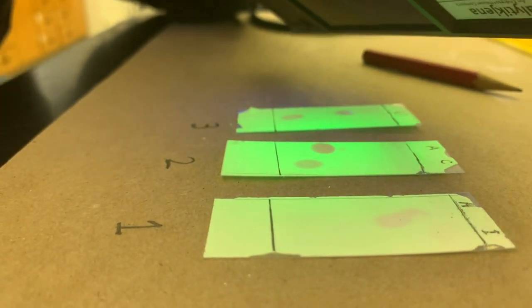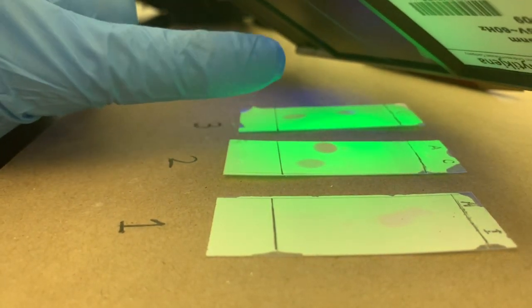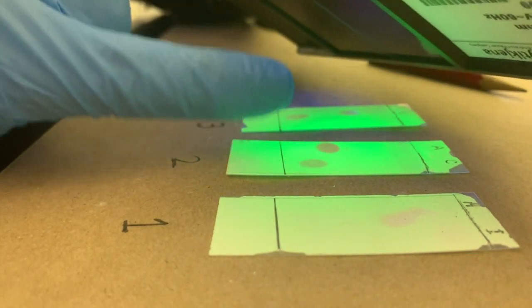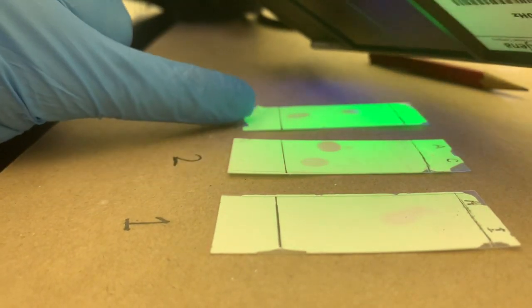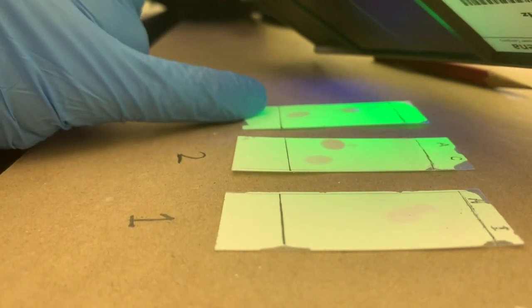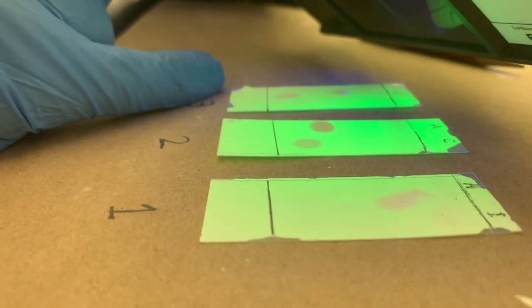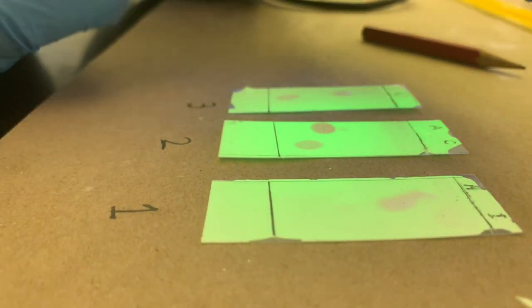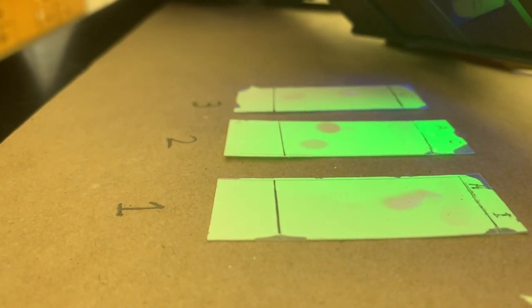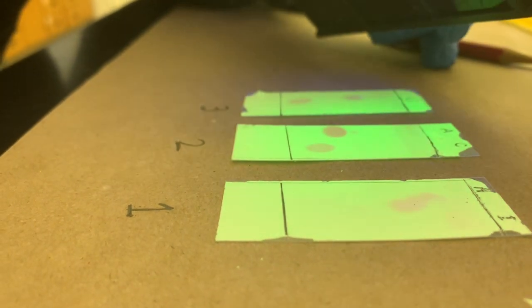We had the original spotted lines, and there might have been some impurity that showed up a little bit later on the second plate right here. And then this third plate had a mixture of 2 compounds, which we're going to identify. If you look across this set of different choices, there are a couple different compounds that seem to be in a similar spot. I'll give you a second to take a guess on that.